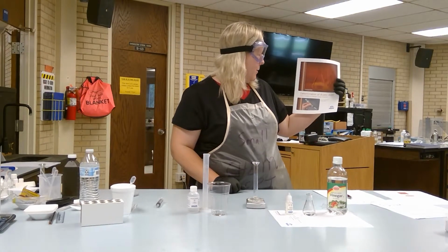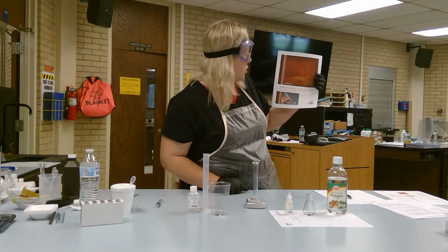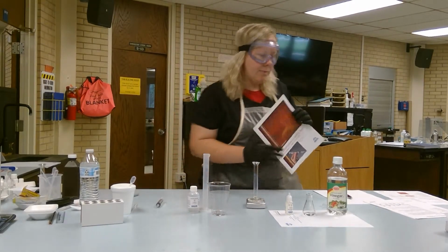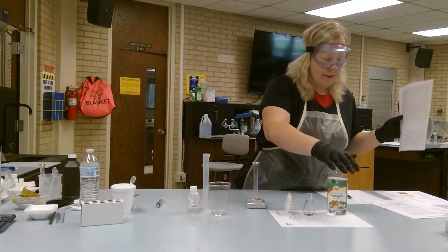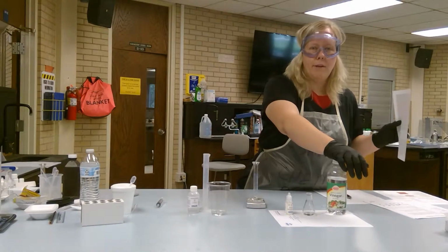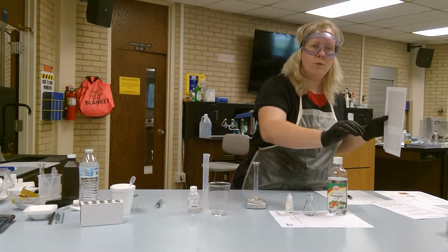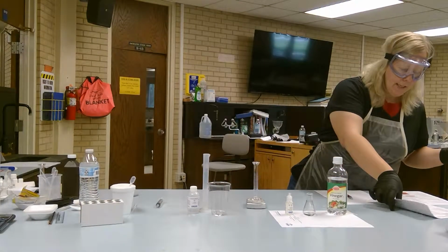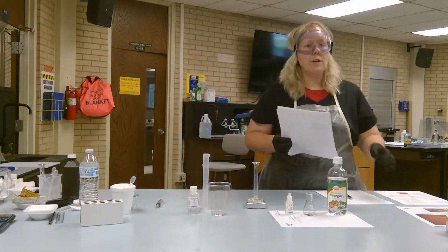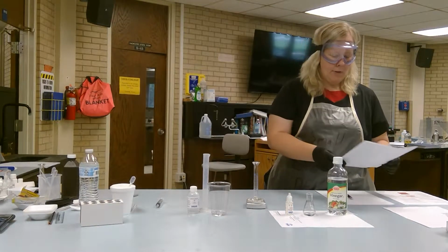But for this one, I'm going to be demonstrating the determination of acetic acid concentration in vinegar using titration. Most of us have gotten used to vinegar and that very foul-smelling odor that comes out of it. Well, that odor is due to acetic acid. There is a known amount in there, and what we're going to be looking for is the concentration, or what molarity value this is.